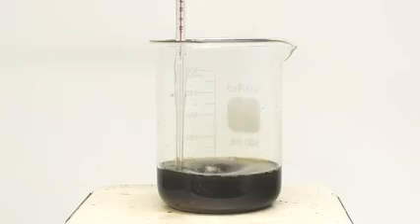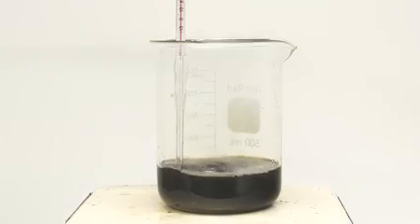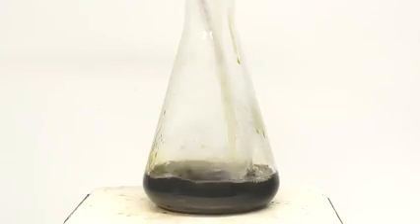This way, we can really promote the formation of triglycerides over things like diglycerides or monoglycerides. So, on top of the already low glycerol estimate, I knocked off another 10%. Anyway, once everything's added, I crank up the heat. I start to get a little bit worried about splashing though, so just to be safe, I transfer everything to an Erlenmeyer flask. The goal now is to heat everything to 195°C and to hold it there for 100 minutes.